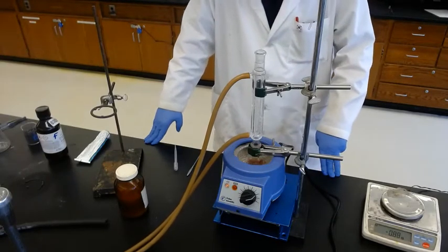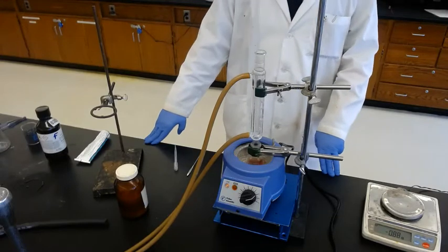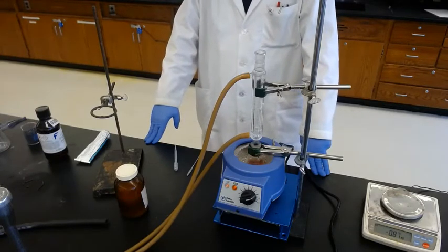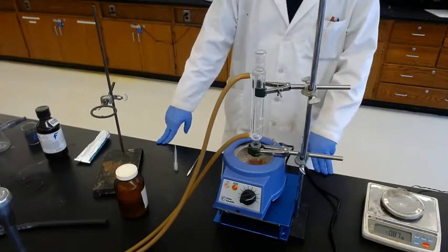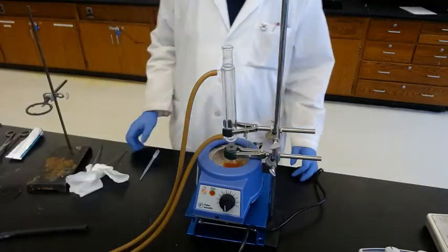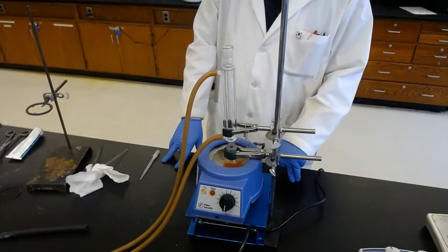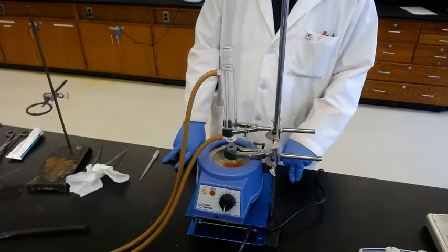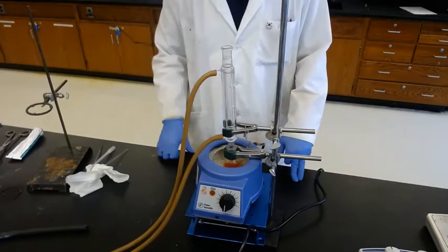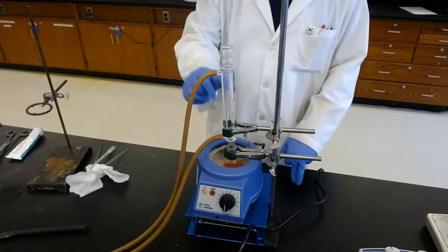It's hot — it's starting to boil. From this moment we count 30 minutes. After 30 minutes of reflux, we cool it down and isolate the crude product, then purify by recrystallization in ethanol. After the 30-minute reflux is completed, turn it off and wait until it's cooled down. Don't disassemble or remove the condenser while the solution is still boiling because solvent vapor is coming out, which is not good for health. Keep the water on because it's still boiling — the solvent vapor is still being produced and needs to be condensed. Water is the last thing you turn off.